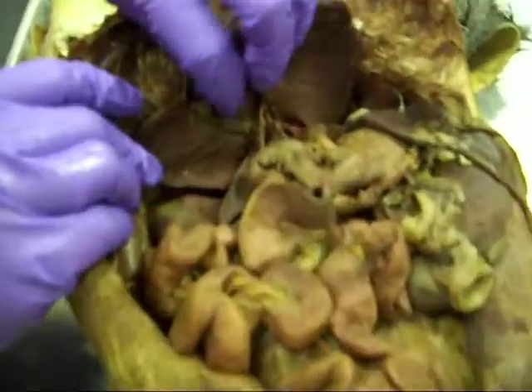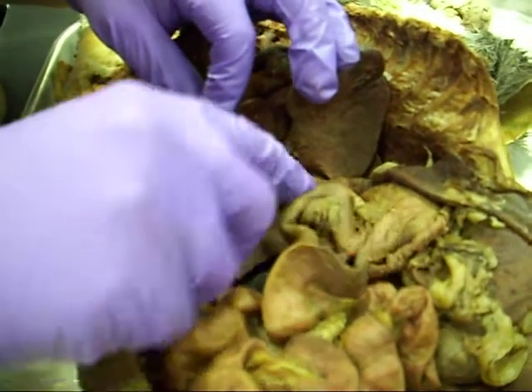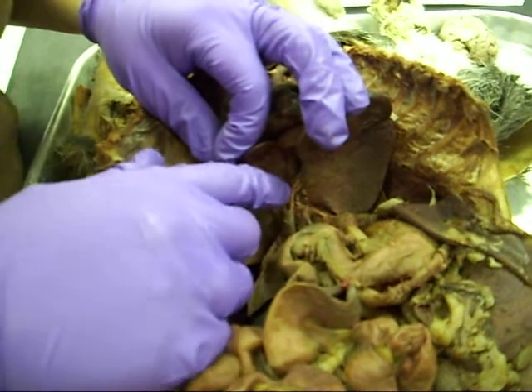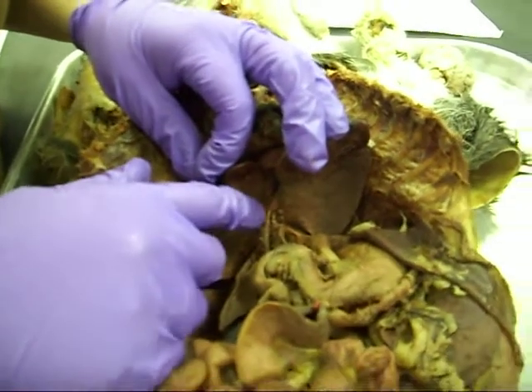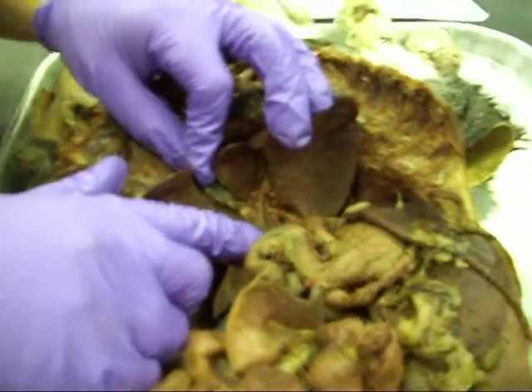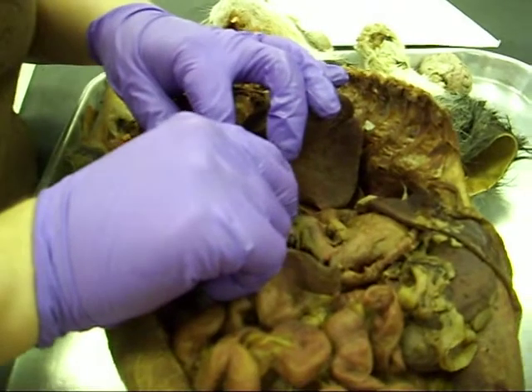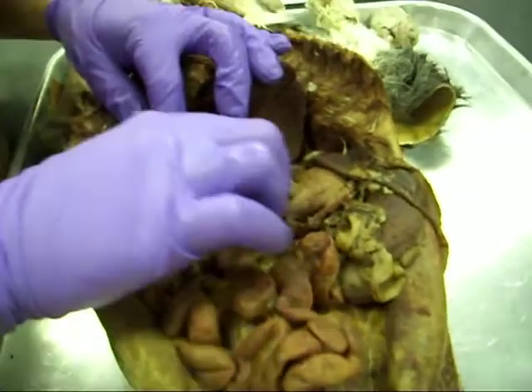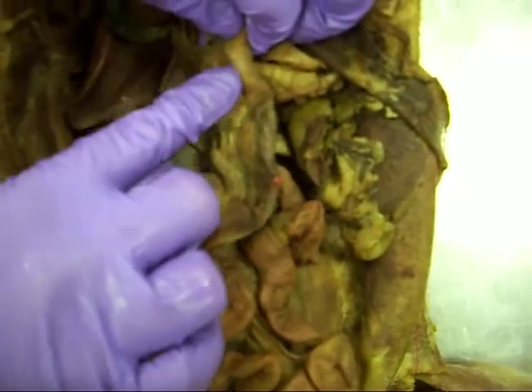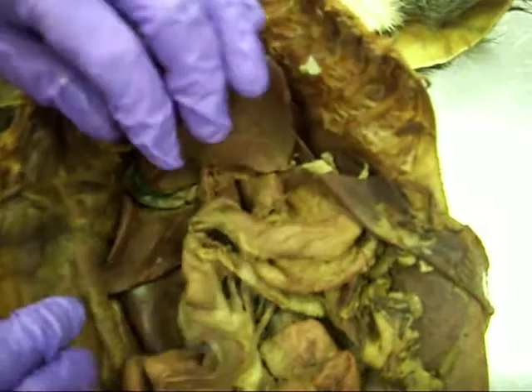In here you see the gallbladder and the duct system. When it comes from the gallbladder, you're talking about the cystic duct. When it comes from the liver in the duct system, that's the hepatic duct. When they join together down here, it becomes the common bile duct. That goes down into this part of the duodenum here, and this would be the ampulla of Vater, where the pancreas also joins it.